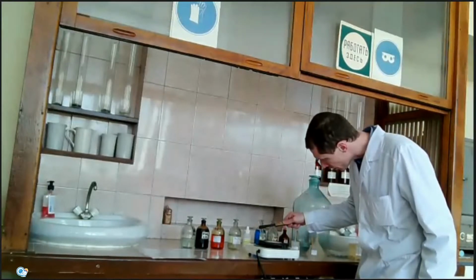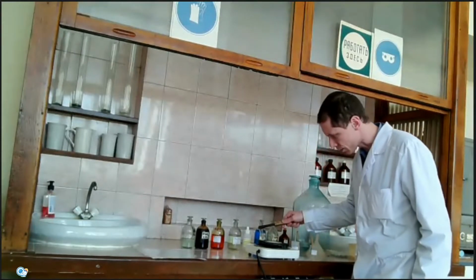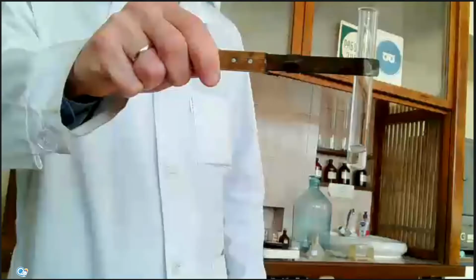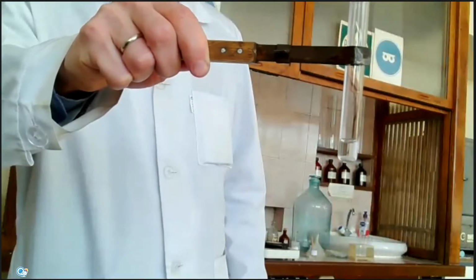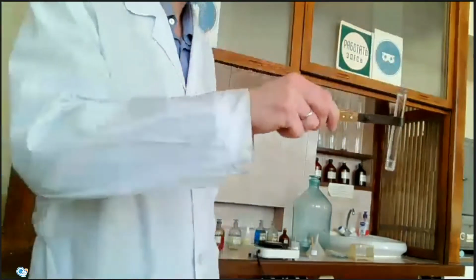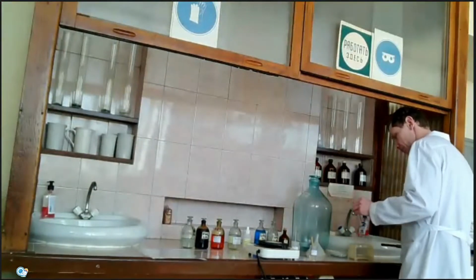and you can see more of hydrogen gas. See these bubbles in the tubes, and the piece of zinc coated with these bubbles of hydrogen. Next reaction.